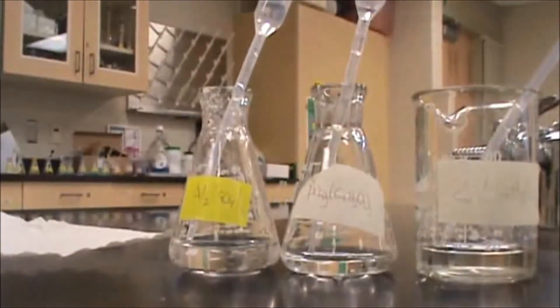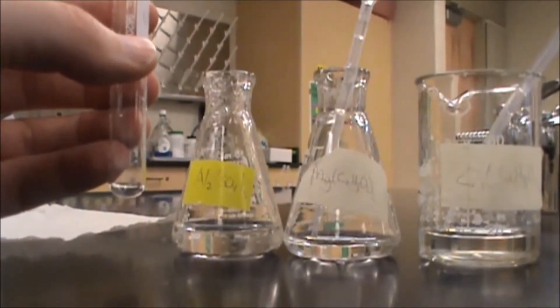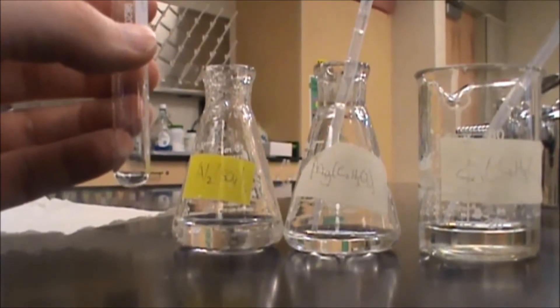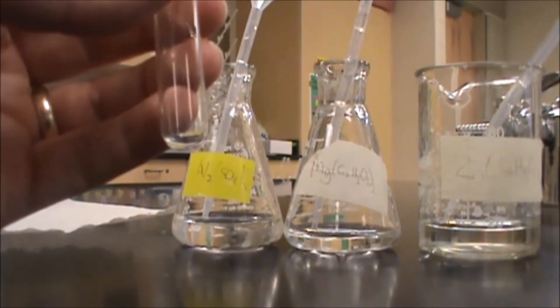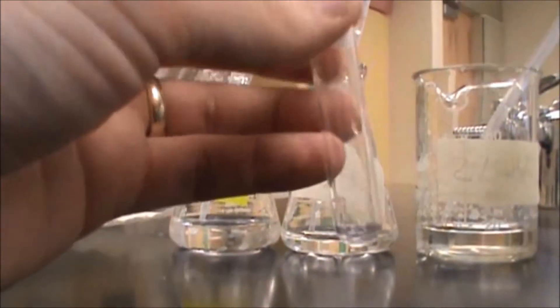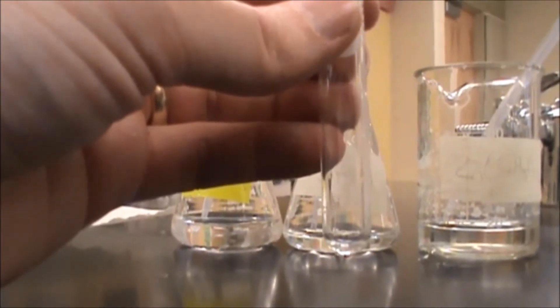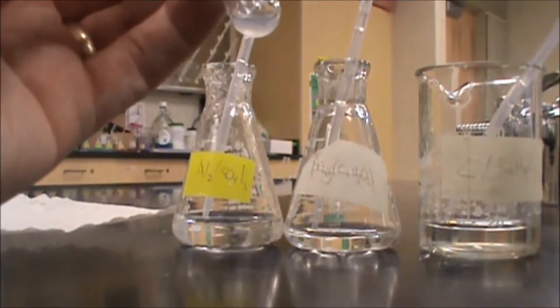So in the next part, we are going to take a drop of Aluminum, you don't need any more than that, you don't want a lot at this point, otherwise you are going to be filling with hydroxide forever. And you are going to add sodium hydroxide to that, and when you mix the two, let's do just a drop here, you can get a precipitate. So we can see that cloudiness.